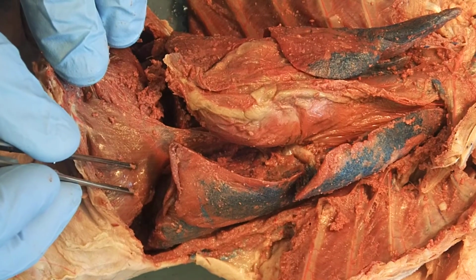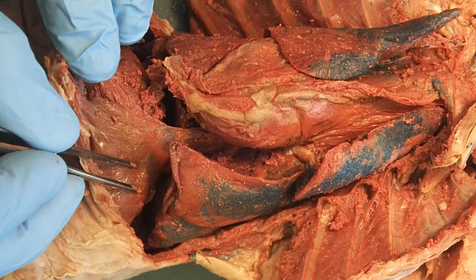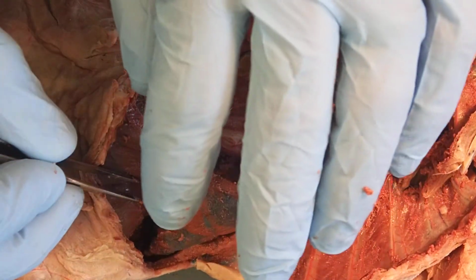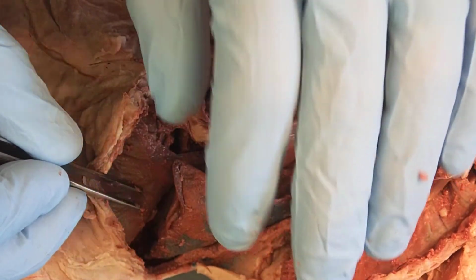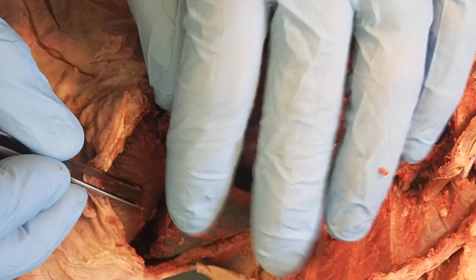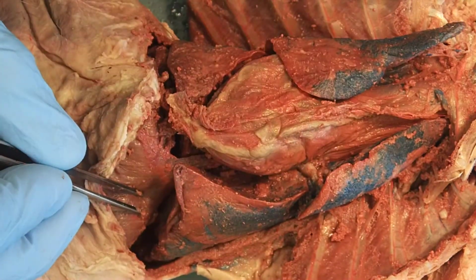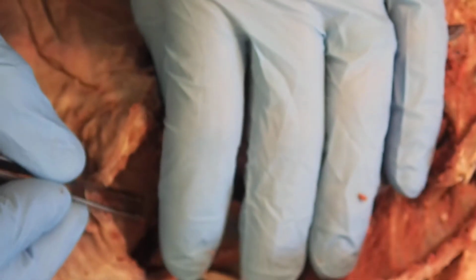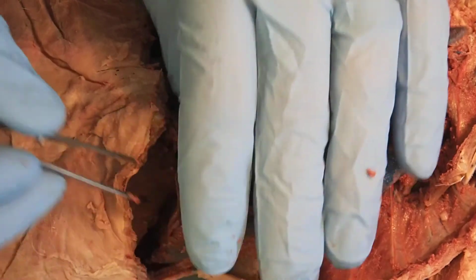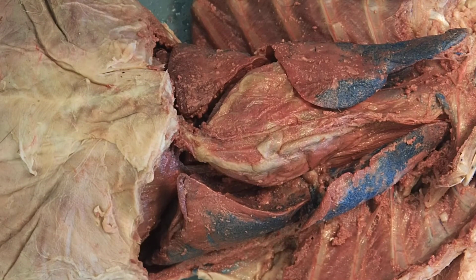It's going to help contract and relax the diaphragm, and ultimately that's going to be what changes the volume of the thoracic cavity. And as the volume increases and decreases, it's changing the pressure gradient within the lungs, ultimately allowing for air to be sucked in and pushed out. That's all being driven by a pressure gradient that's ultimately created by changes in volume. I'll go over that in just a little bit as well. And that should do it for the thoracic cavity.